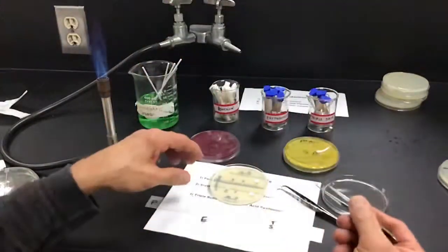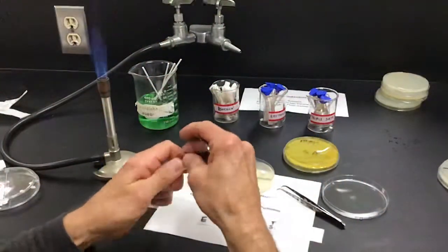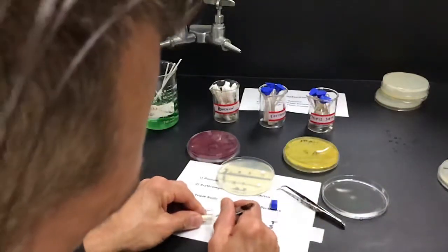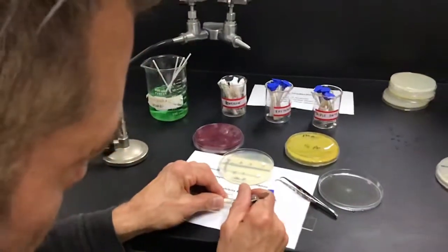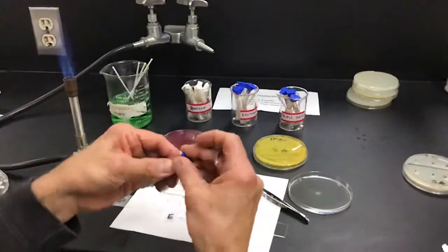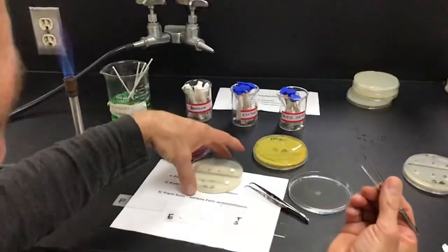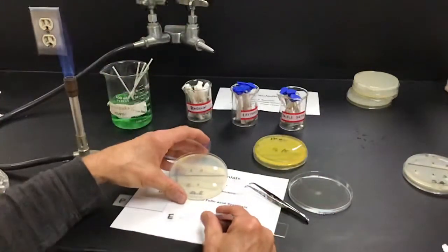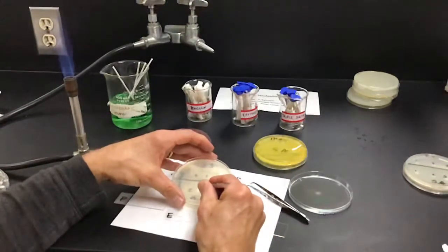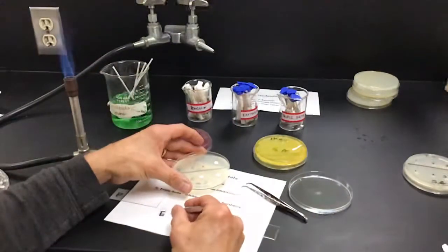All right, let's move on to our erythromycin. Remember, once again, this is our ribosomal inhibitor. So we know that all bacteria have ribosomes. So this should definitely work. And if you guys remember, the only problem with these is that mitochondrial ribosomes and bacterial ribosomes are similar. So the only issue with these sometimes is that some of these can affect human ribosomes, the mitochondrial ones.